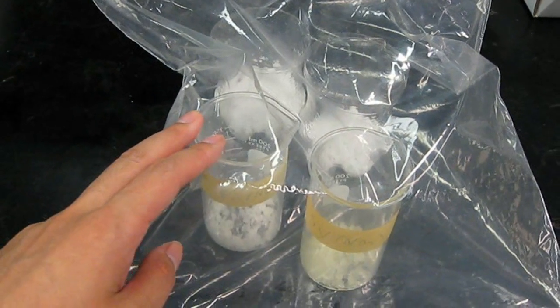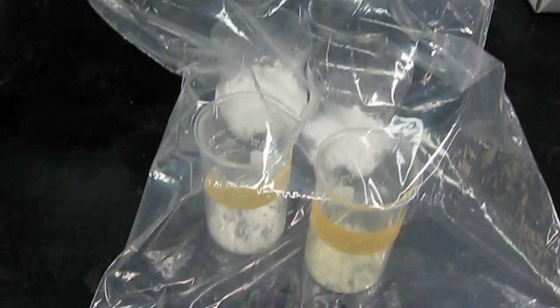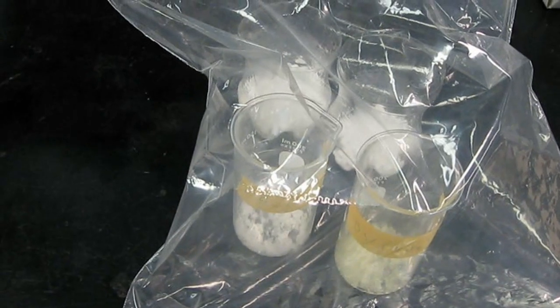So that's how you make a desiccator bag. Not the coolest thing but extremely important if you're serious about chemistry.